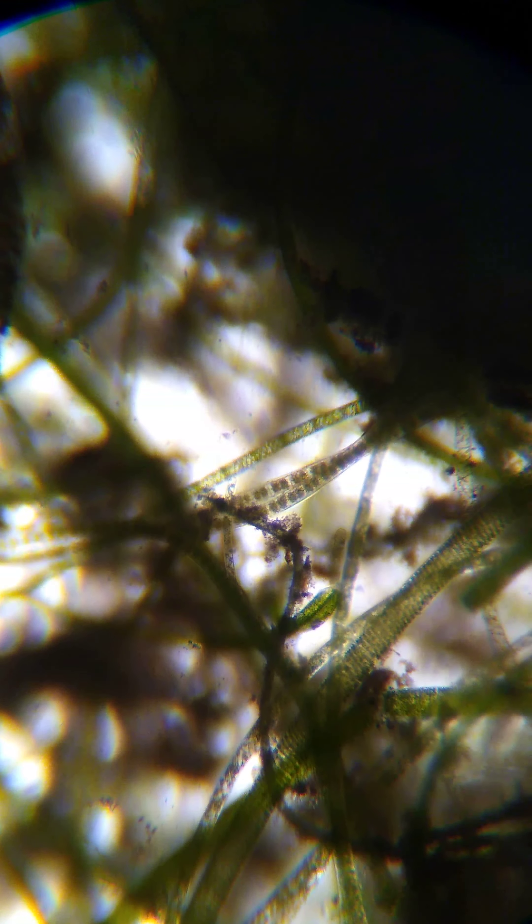But with the microscope, I want to show you what we can do: as we zoom in, there are different zones that you hit. Right here we are looking at the surface of the water — very surface, kind of jiggly. As we go deeper, we get into the algae. And then if we go even deeper, we get to the gunk that's on the very bottom.